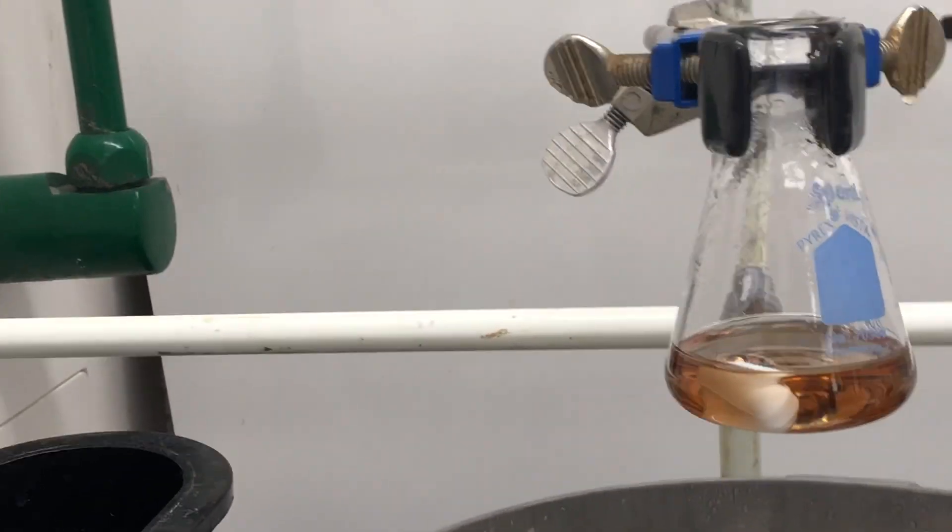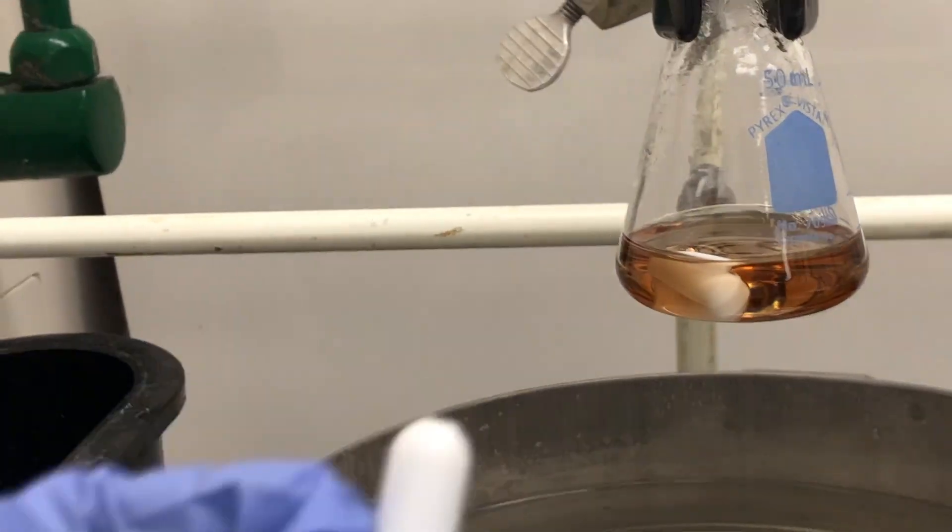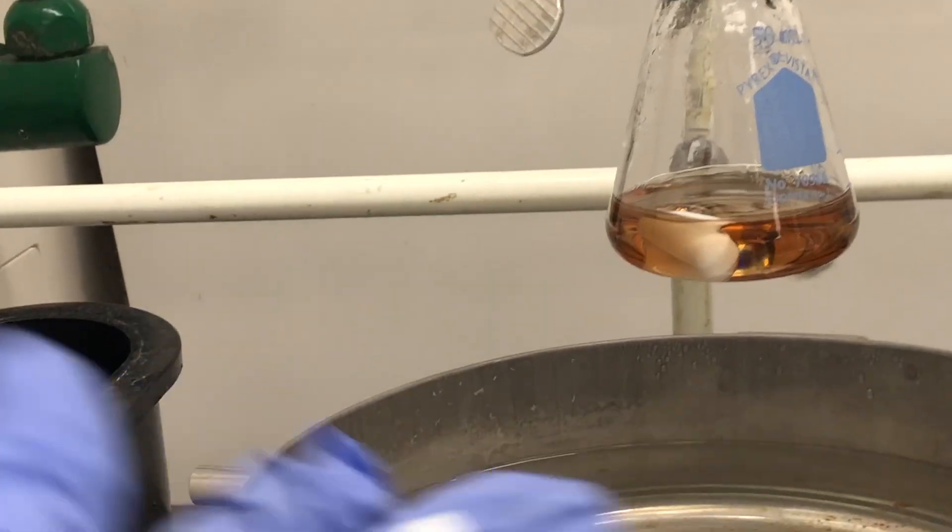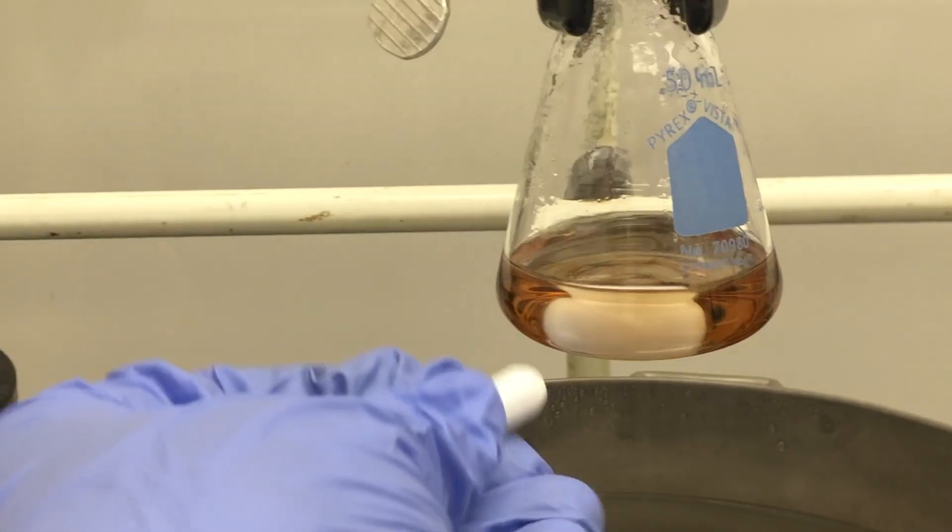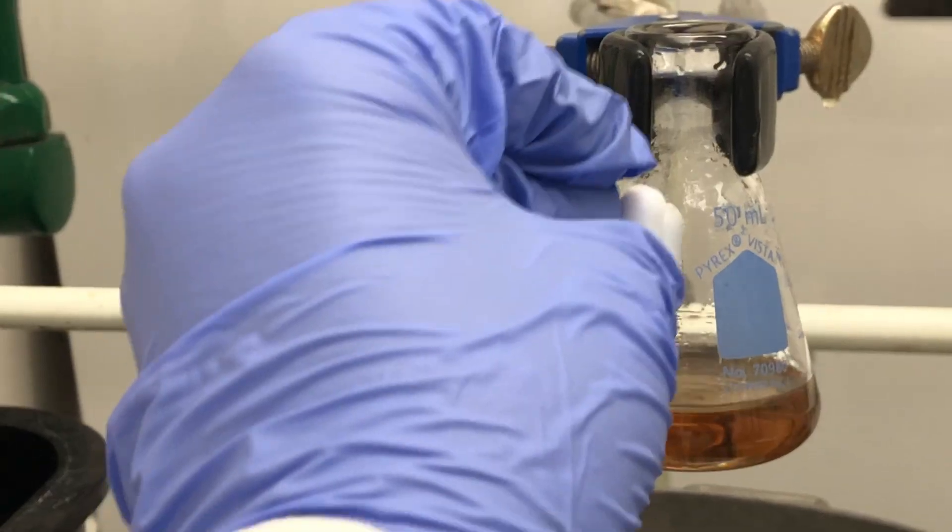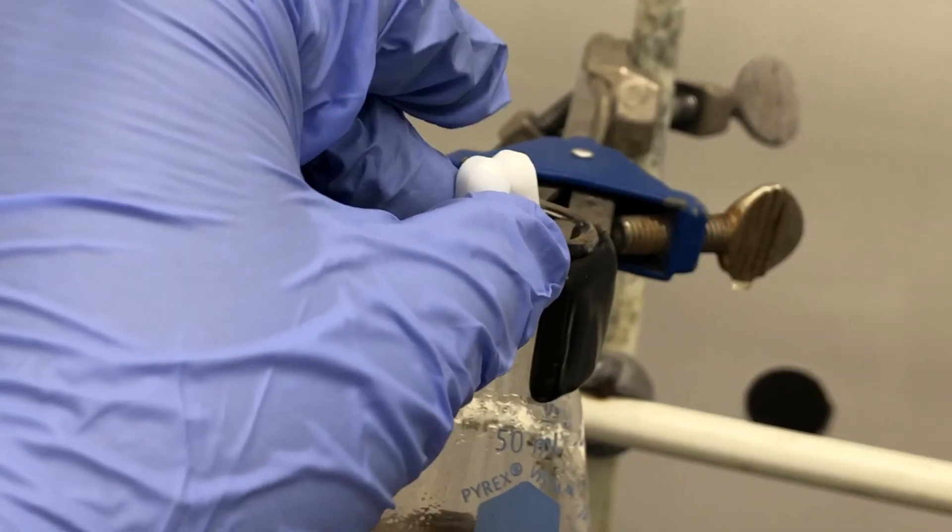What I'll do is take another stir bar and use that, just a regular stir bar, to remove the stir bar that's in solution. And here we are.